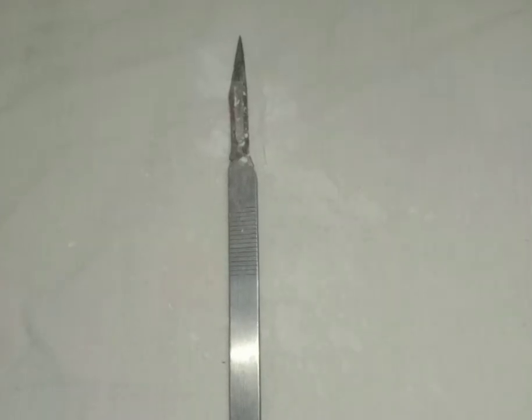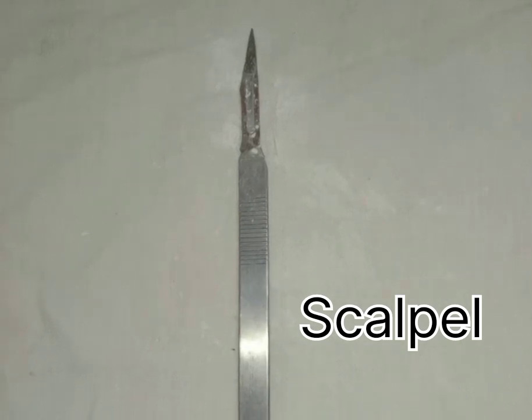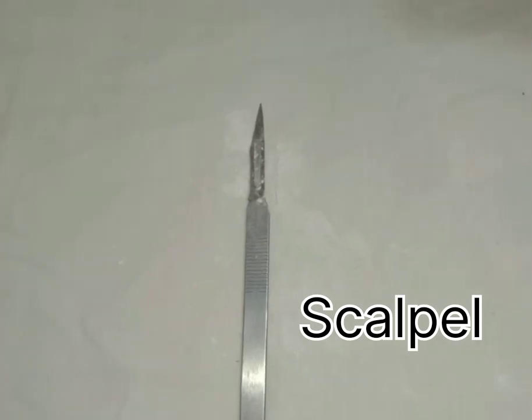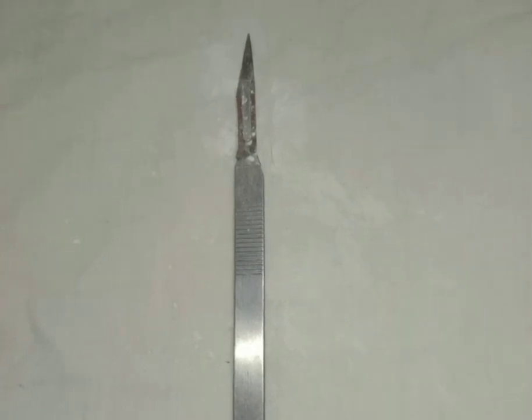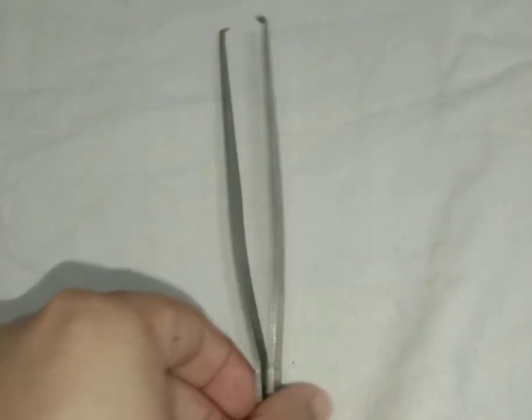The first most important tool in dissection is the scalpel, which contains a blade that is very sharp and used for cutting the tissues and especially the upper surface of skin. So dissection starts with the scalpel, but generally we avoid dissecting the internal parts of our body in order to avoid damage. And there are different types of forceps we use in dissection.